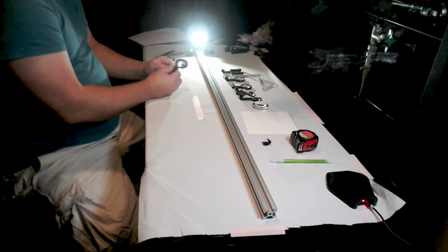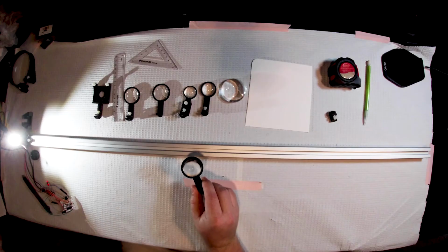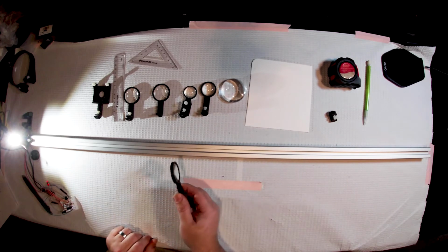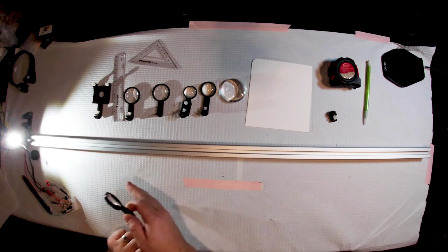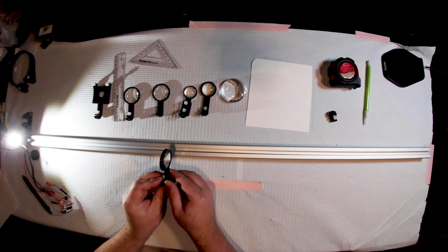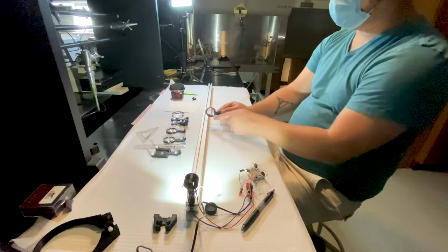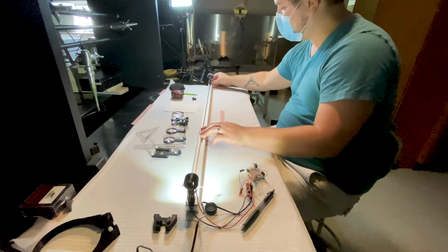So we're going to take our eyepiece lens and we are going to mount that right up next to the LED and try to figure out where's the best location to put this so that we get more or less even illumination across our sample. So again, we have diverging light. So it's going to be better to put the flat side of this eyepiece up against the LED. So we're going to go ahead and slide that guy down in there.